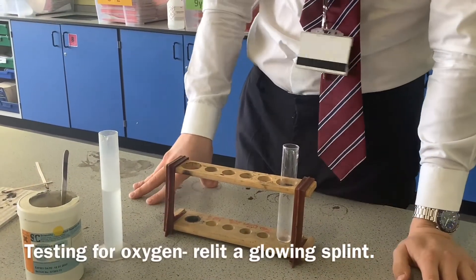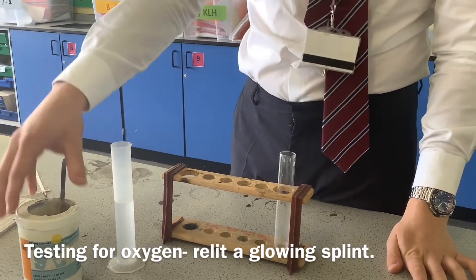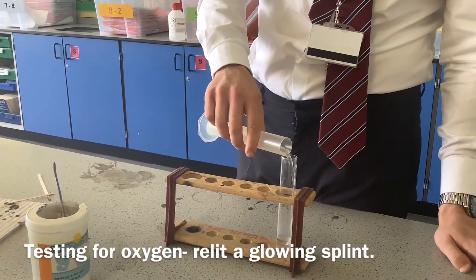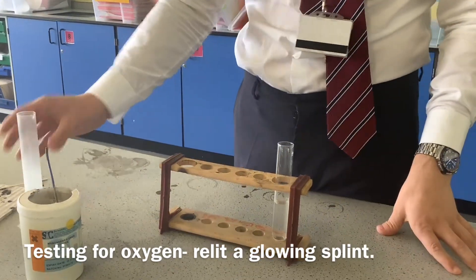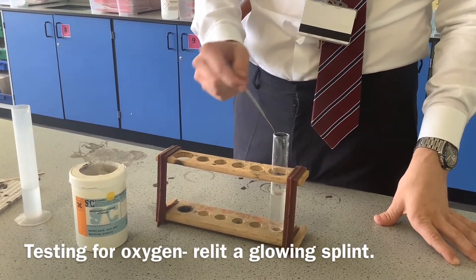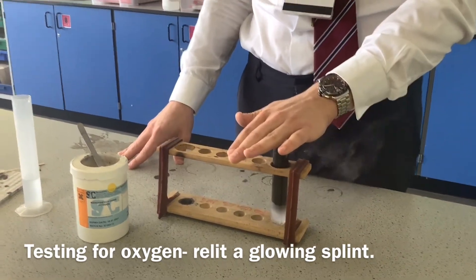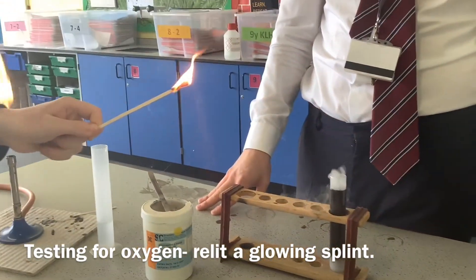Another specified practical — we're looking at identifying oxygen. I've got some hydrogen peroxide, H₂O₂, and my catalyst here, manganese oxide. Hydrogen peroxide turns into oxygen gas very, very slowly, but we know from our rates module that a catalyst is going to increase the rate quickly. So I'll place a spatula of the catalyst in there, and then I'm going to have a splint which has just been put out. We're going to place that back in and it's going to relight because the oxygen is helping it combust.